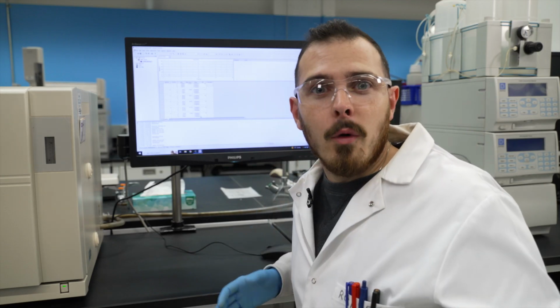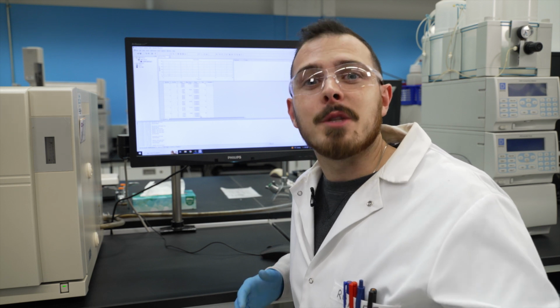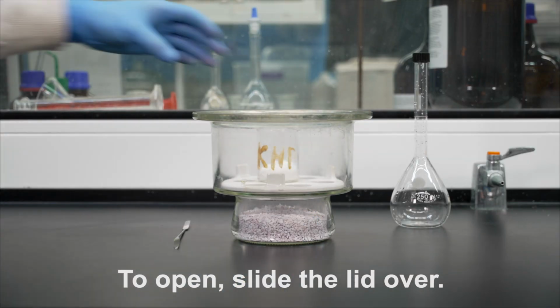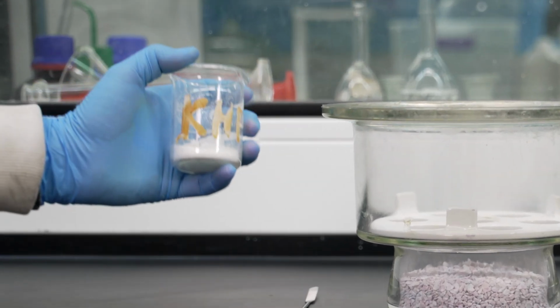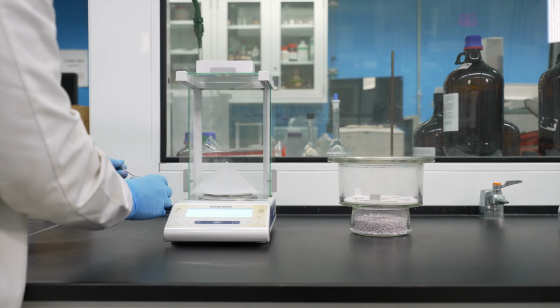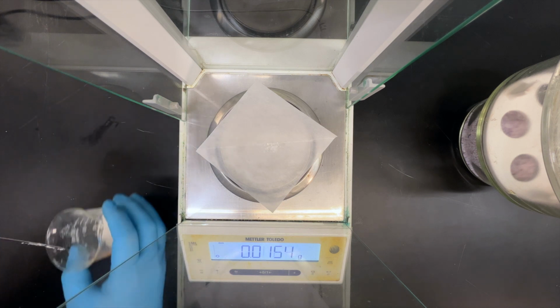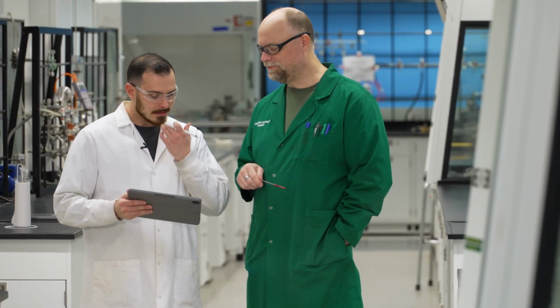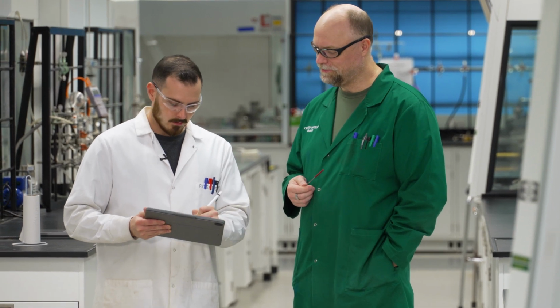Now, I know you've heard this before, but make sure to finish your pre-lab calculations before you come into your lab. You get started by preparing a stock solution from a reagent of potassium hydrogen phthalate. Figuring out how much KHP is needed is crucial for making an accurate stock solution. Verify your calculations with your TA or lab coordinator before you get started.